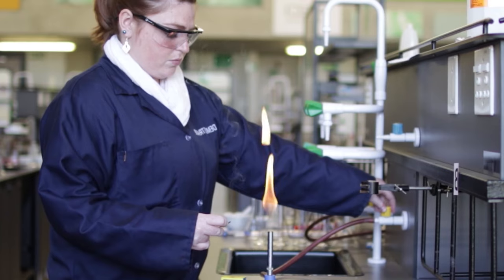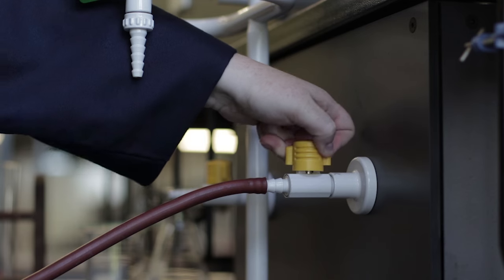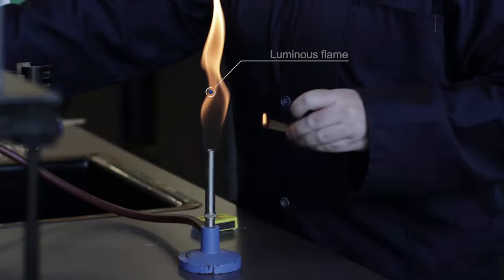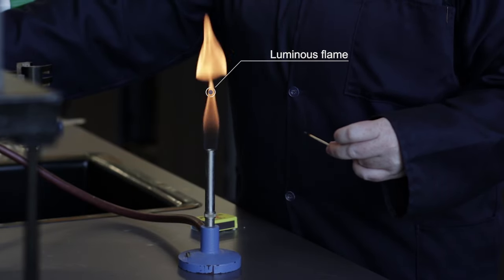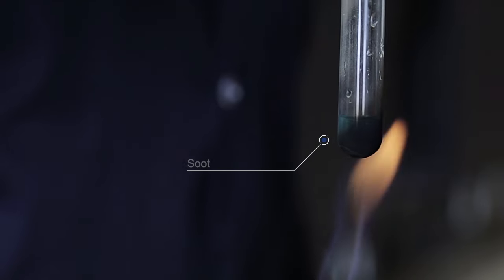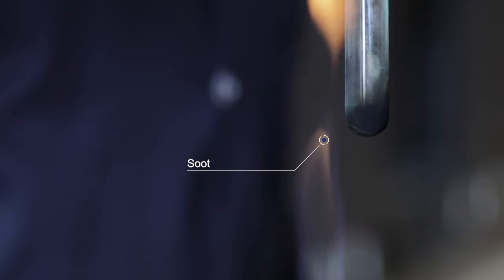Step 3: Increase or decrease the gas supply using the gas tap to get a suitable flame size. At this point the flame is still a luminous flame and it is not used for heating substances in the lab as it deposits soot on the apparatus. Therefore we want a non-luminous flame which is a pale blue flame.